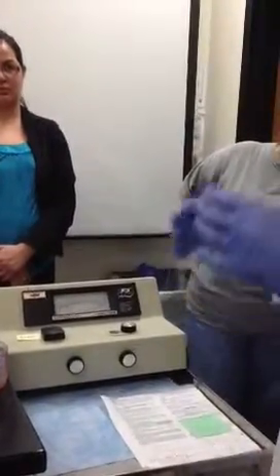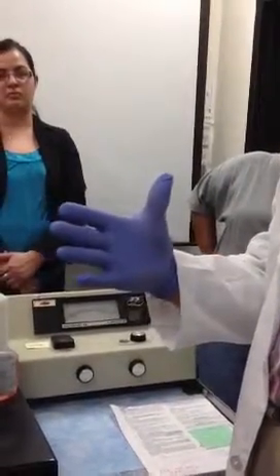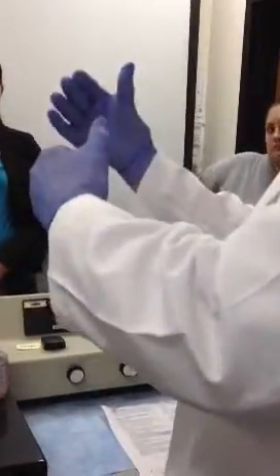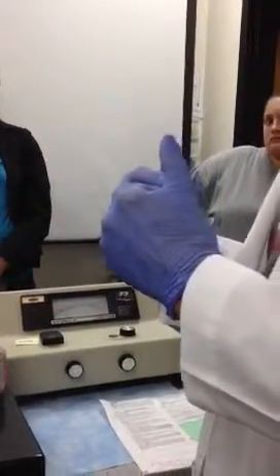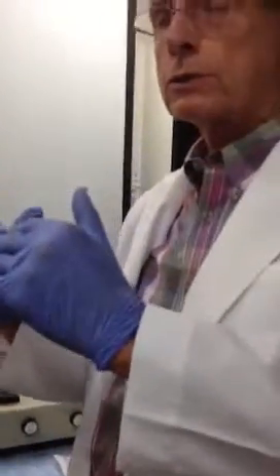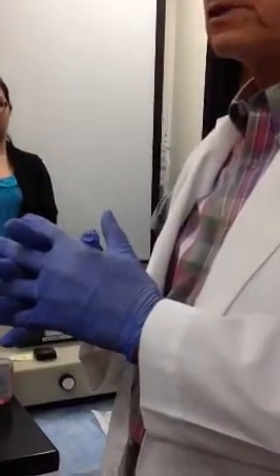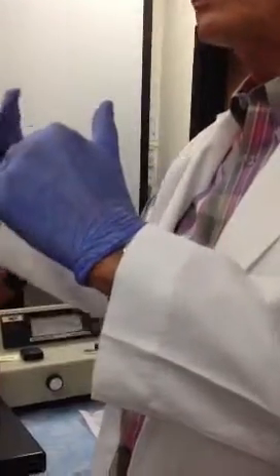So what do we know already about the patient's cholesterol relative to our standard? It's higher, isn't it? Because the number we just read is significantly higher than the first number we read. So it's a ratio, isn't it? All right, so how are we going to then come up with a number for the concentration of cholesterol in our patient? Do you just divide one by the other for a percentage? No, well, we multiply the ratio times 200.